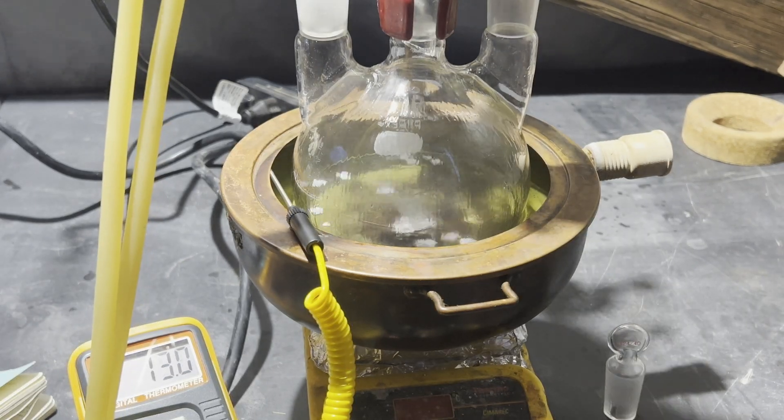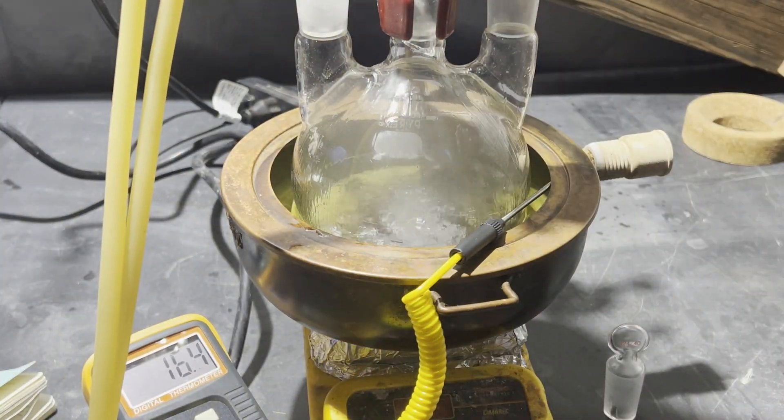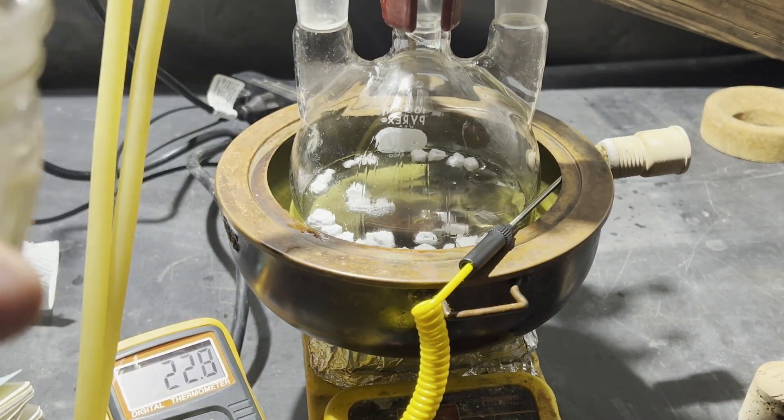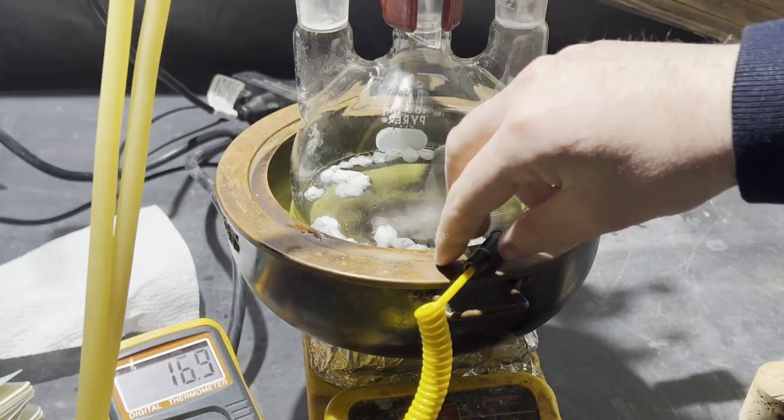Once it's all added, I reflux the mixture until all the sodium dissolves, which takes a little over an hour. The original procedure took like 3 or 4 hours because they did it on like 3 times this scale.